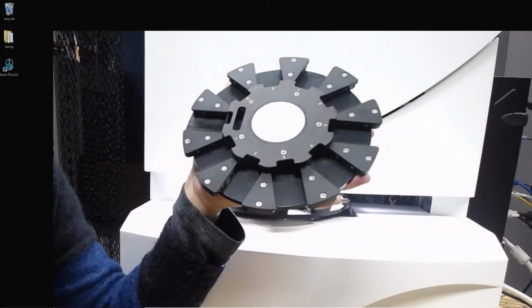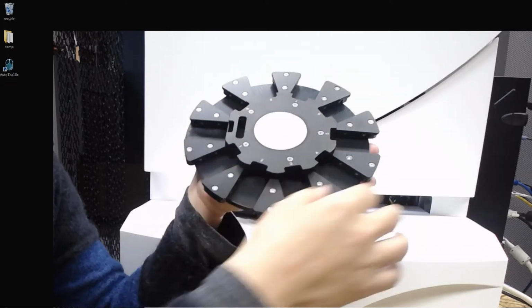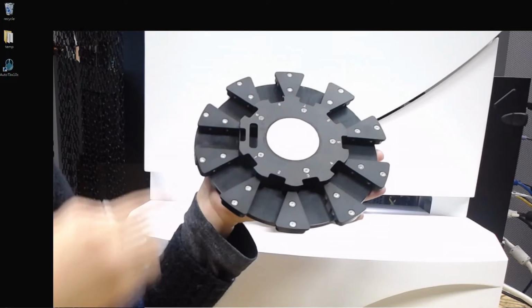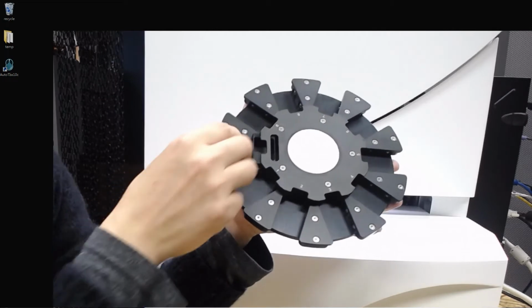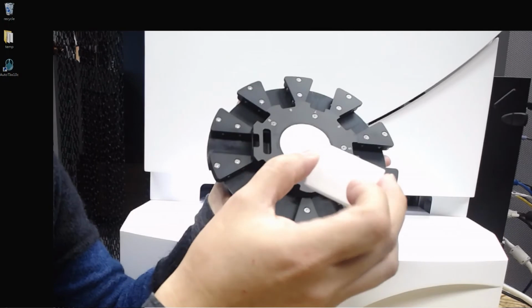The machine has this rotator, and you can take up to 9 donor blocks from here to here, and also one recipient block which comes at this position. And there's a collector. This collector is for storing the recipient waste.